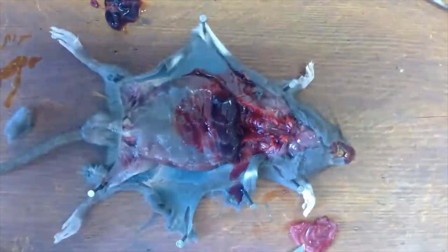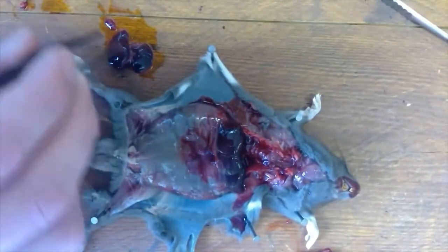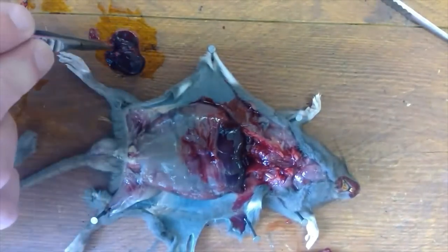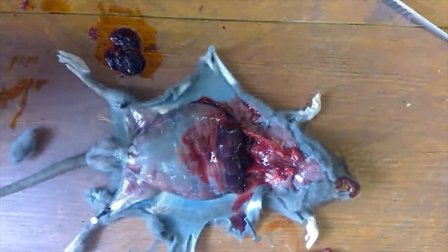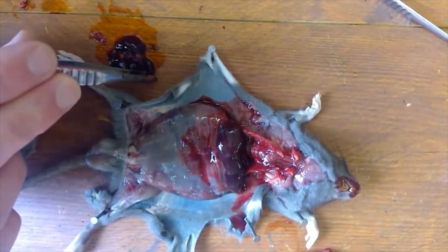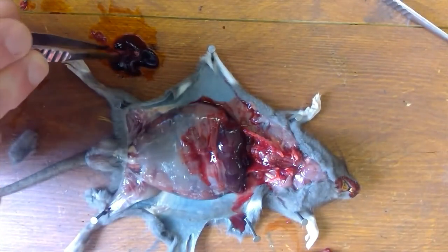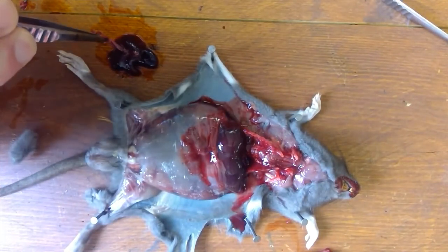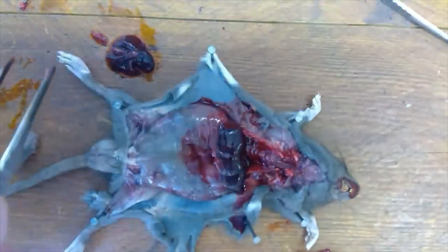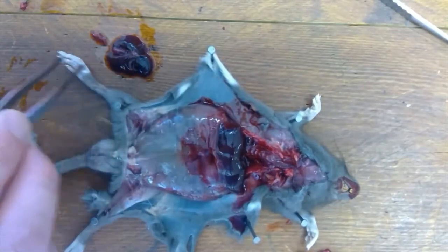At the moment it's looking a bit like a blob, but hopefully we can see them better. You can now see the two lungs: there's the left lung here and the right lung over here, and this is the heart at the top. There's the trachea coming down there. The function of the cardiovascular system is to deliver oxygenated blood to the rest of the body — the heart is the pump, and the lungs are where gas exchange occurs.